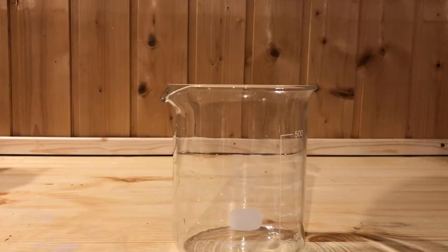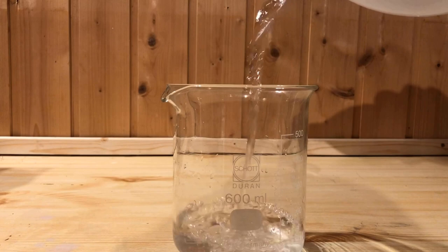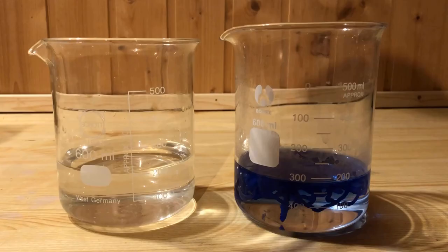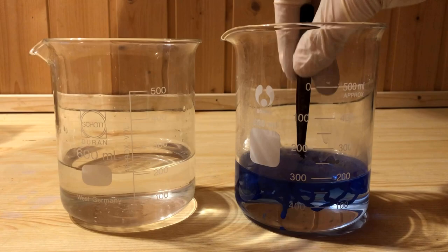Meanwhile, 200 ml of distilled water is added to a fresh beaker. The cured artificial silk thread is placed in the distilled water for another 15 minutes.